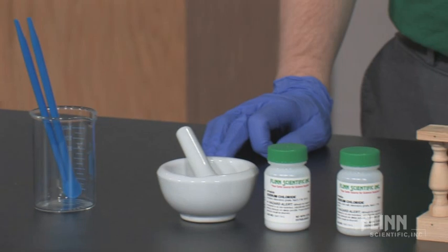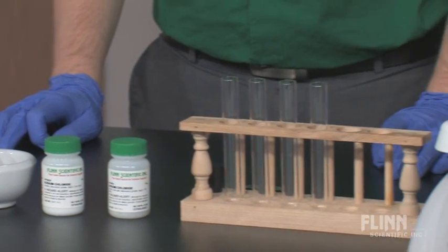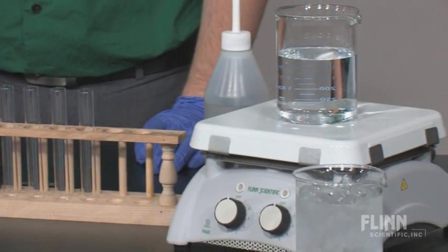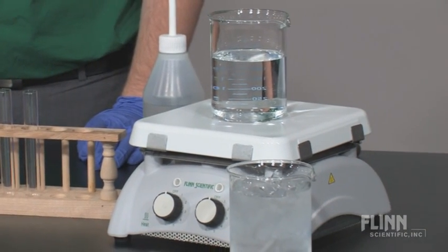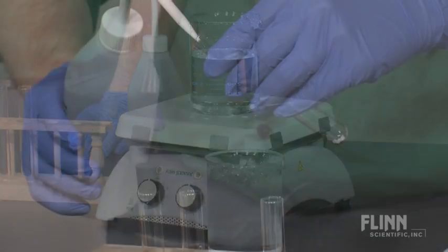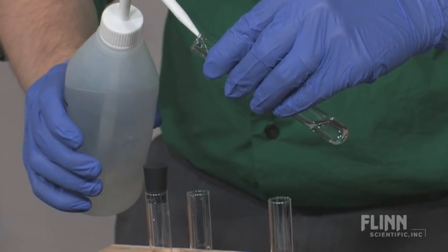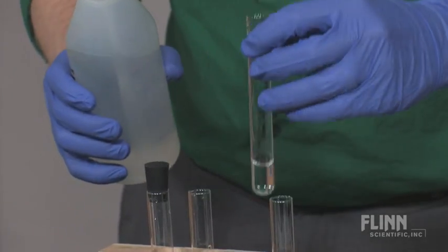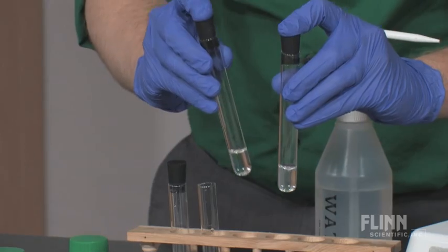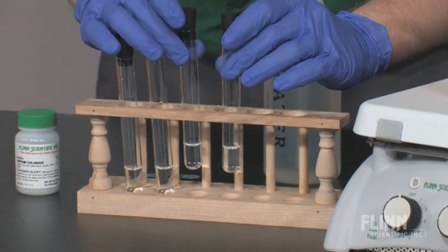In this laboratory activity, students investigate different factors that can affect the rate at which a solute dissolves in a solution. Students can explore the effects of stirring, temperature, surface area, and the amount of solute already present in the solution.